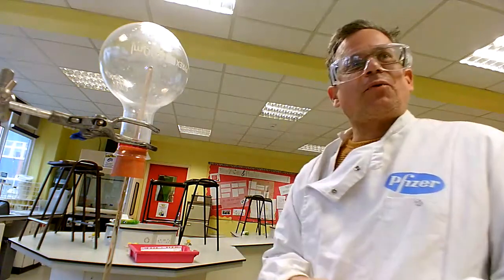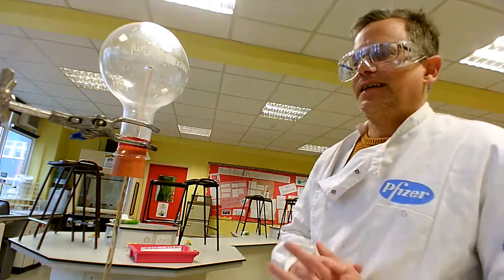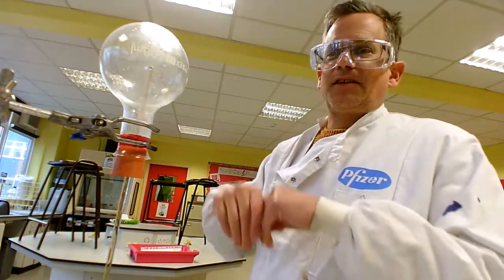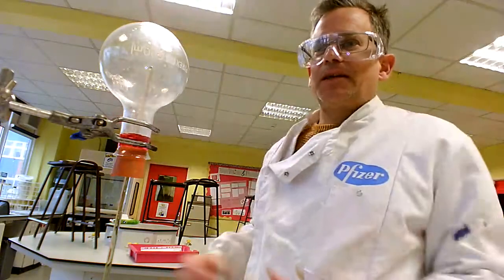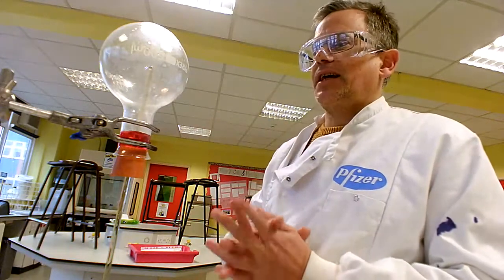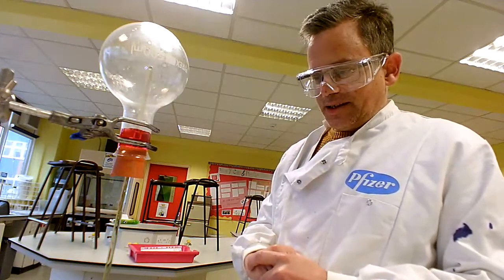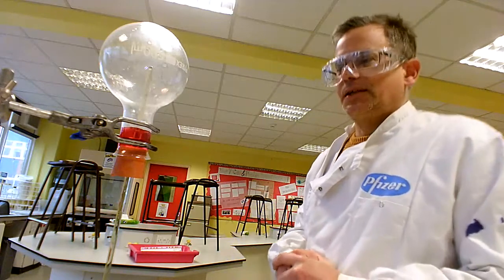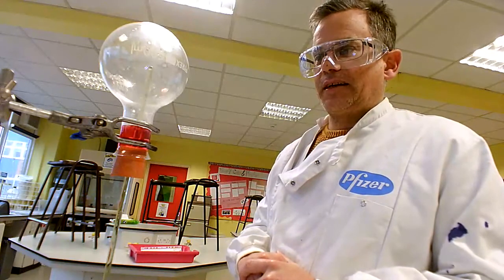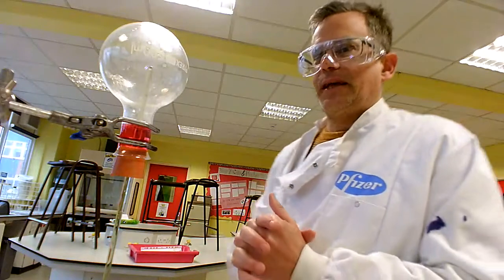Unfortunately it's not been quite as spectacular as we would hope. The name of this demonstration is the fountain experiment, and sometimes the liquid literally sprays and fills the entire flask. Unfortunately today it's more of a dribble than a fountain, but the water is continuing to come into the flask and it is turning the indicator red. So two properties of hydrogen chloride are being demonstrated here.